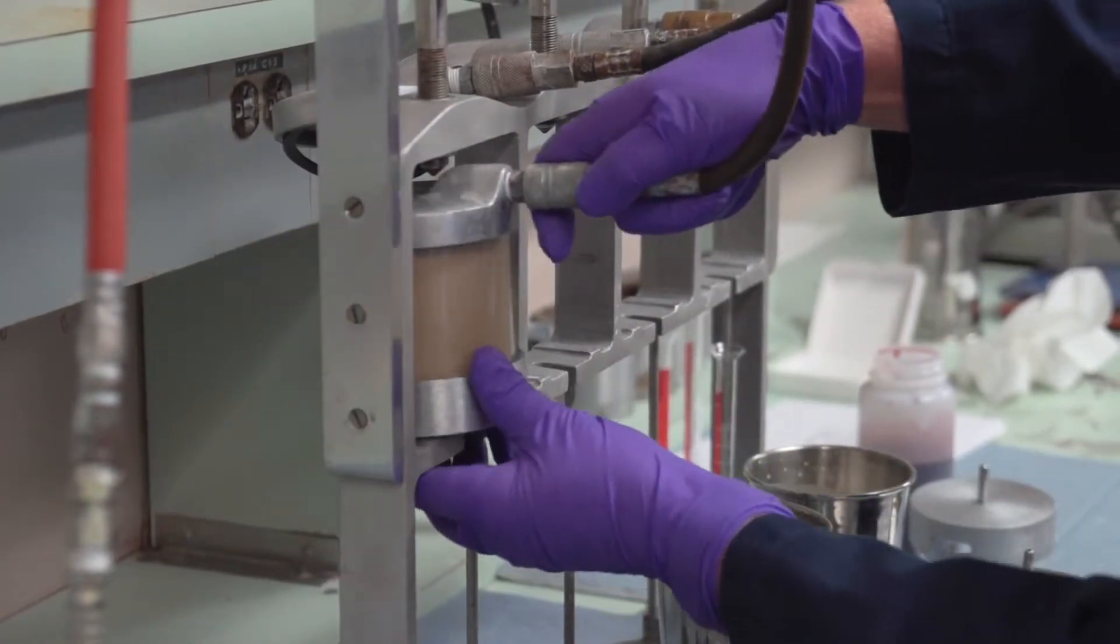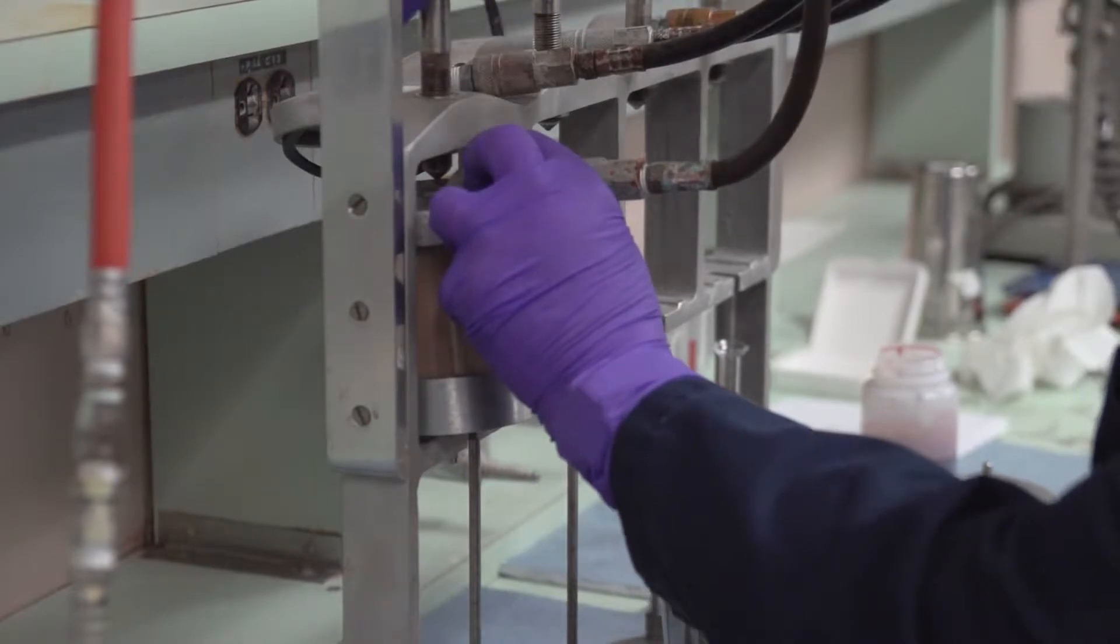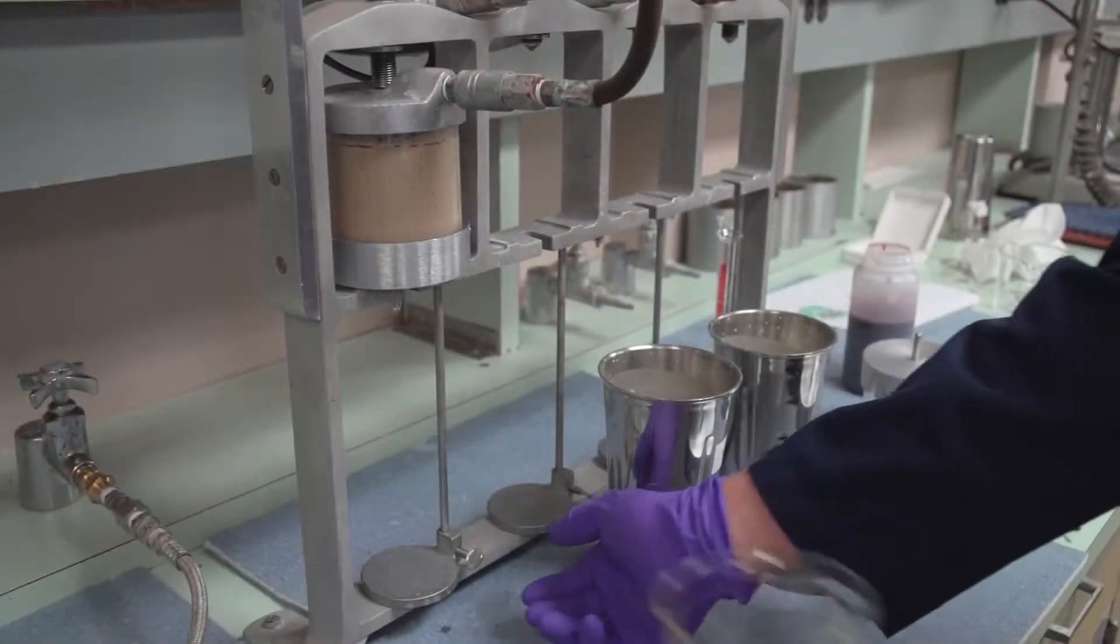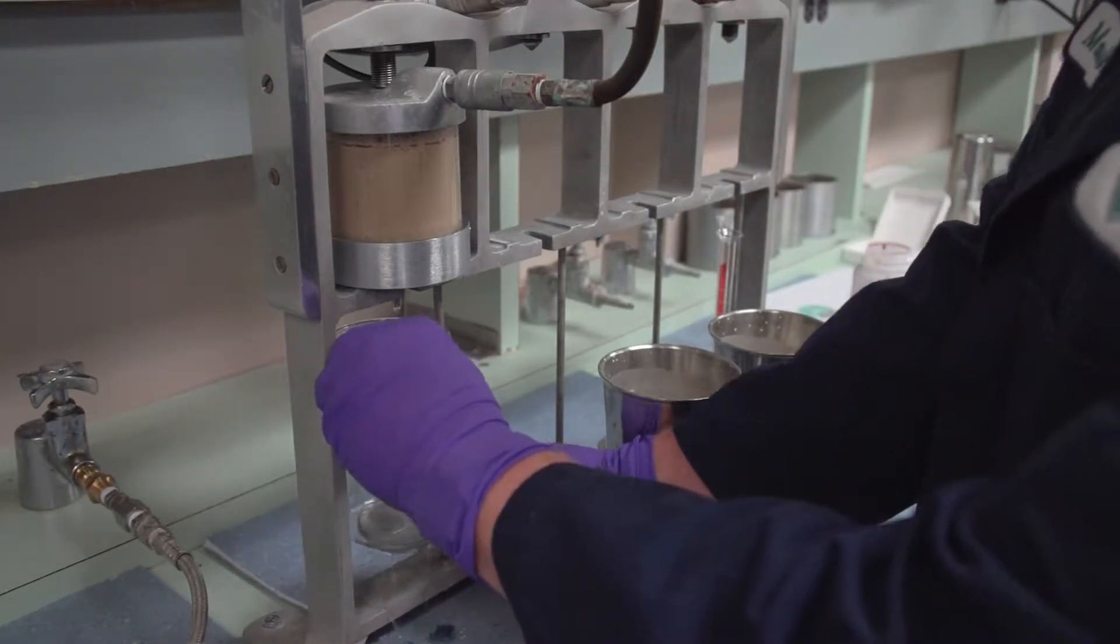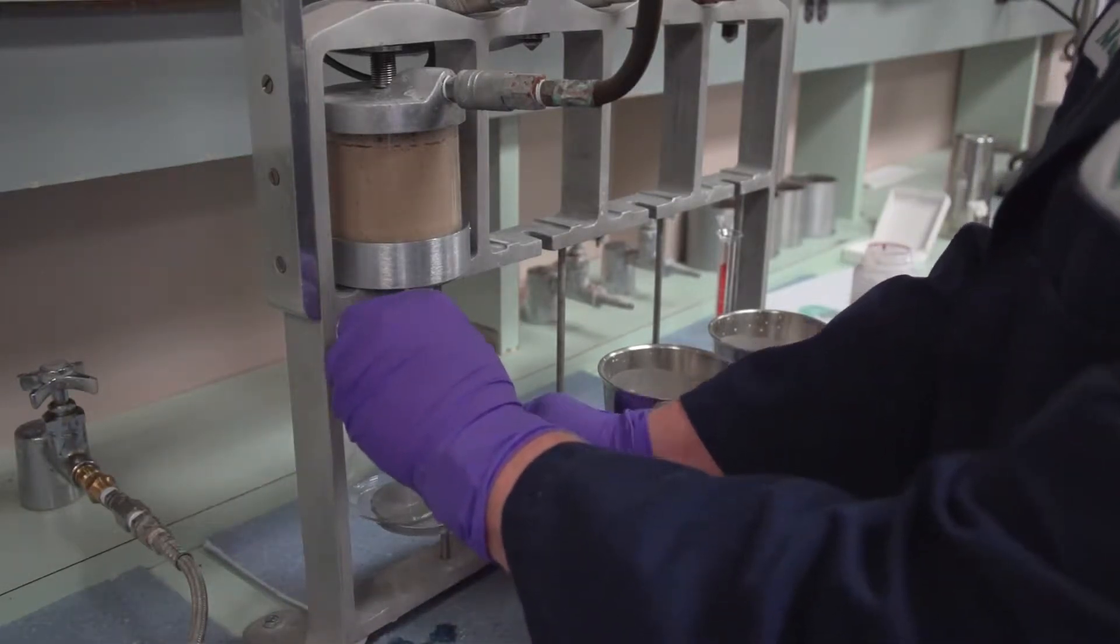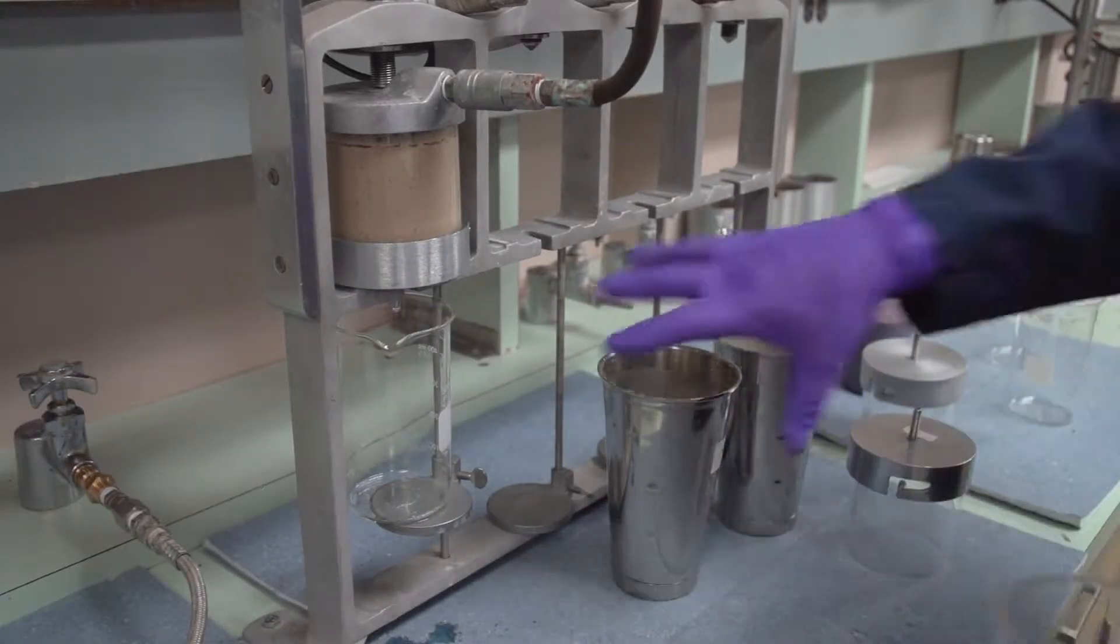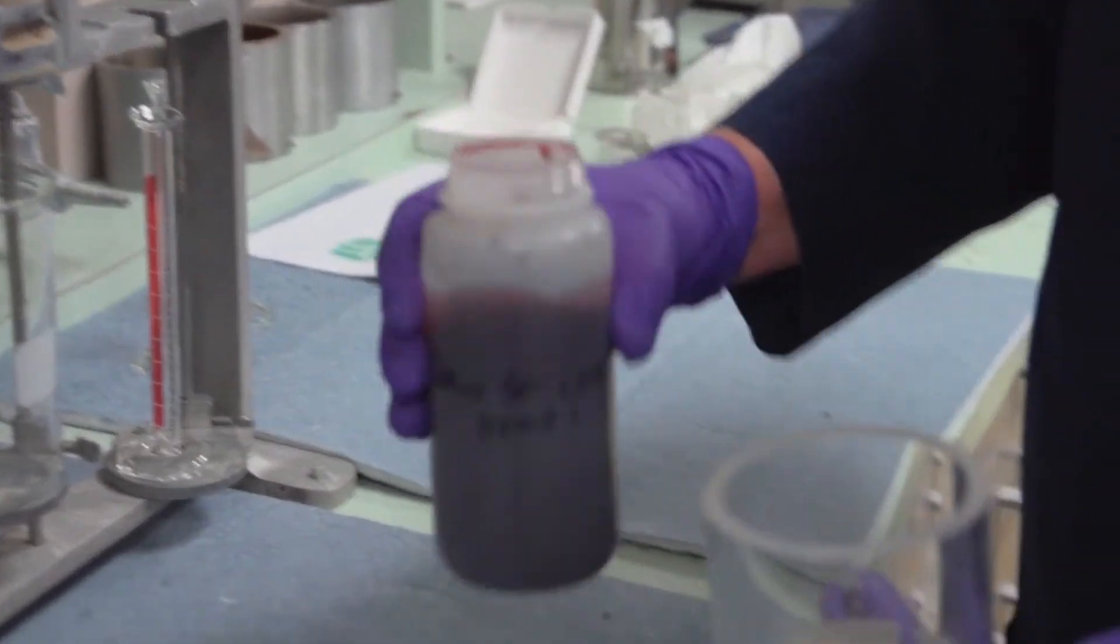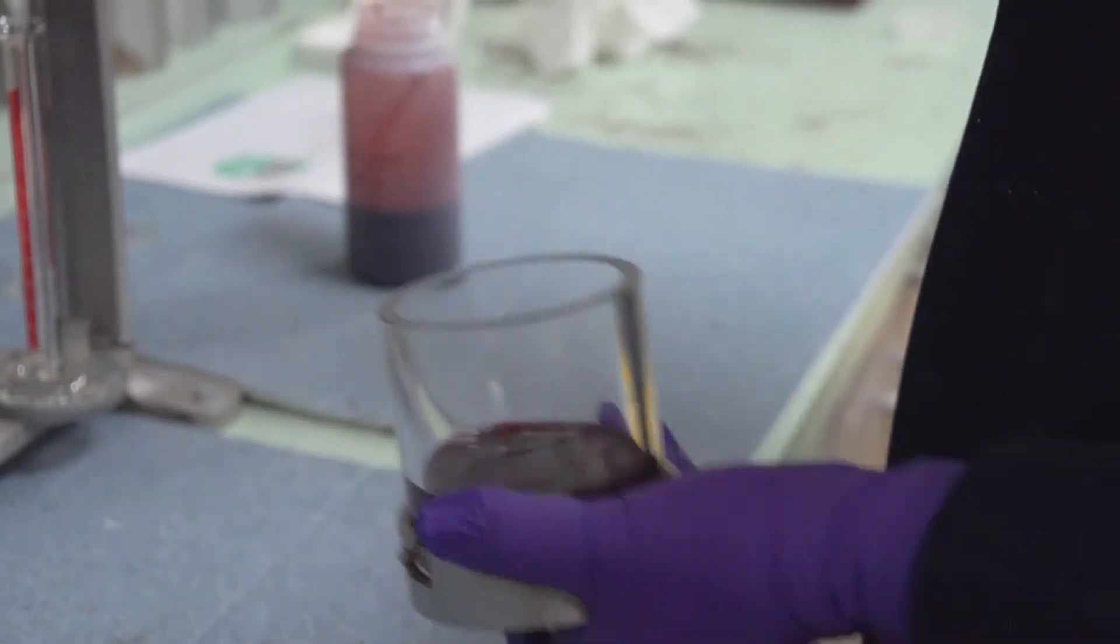Now I'm going to put a beaker in here to collect the filtrate. And then I'll repeat the steps with the others. Then in the last one, I'm going to actually put some drilling fluid to show you how that will not have much filtration.